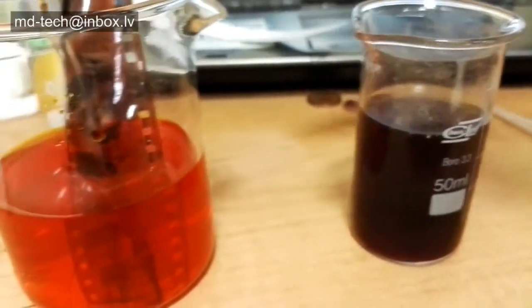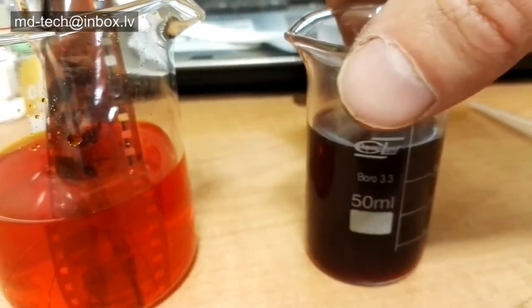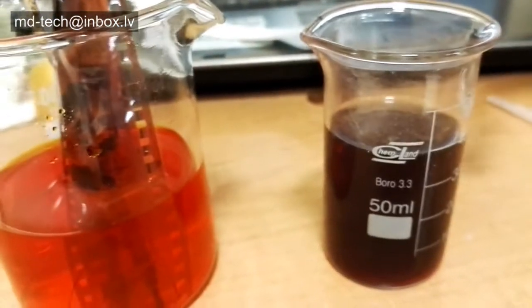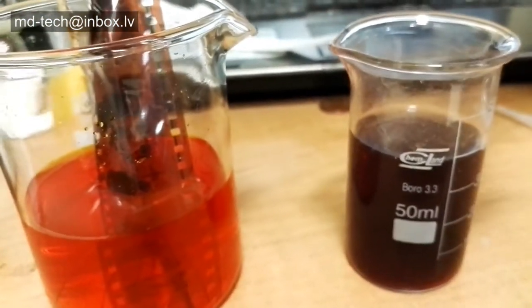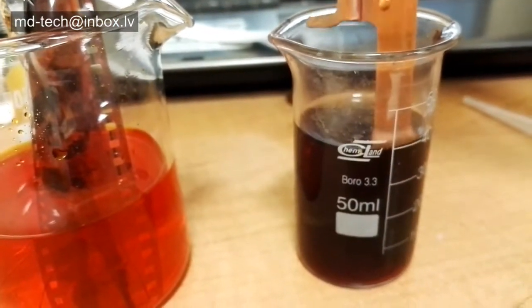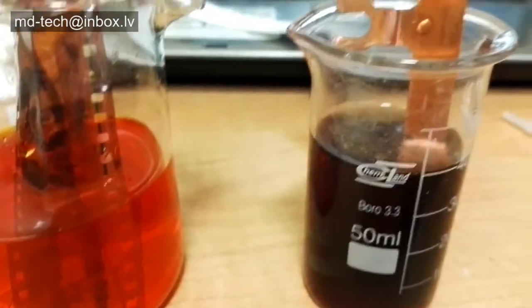I use Schweitzer's solution to remove silver coating from many surfaces: old mirrors, chrome spray surfaces, and also old photo films and electronics. Silver recovery is very easy. Just put in copper wire and silver cements out.